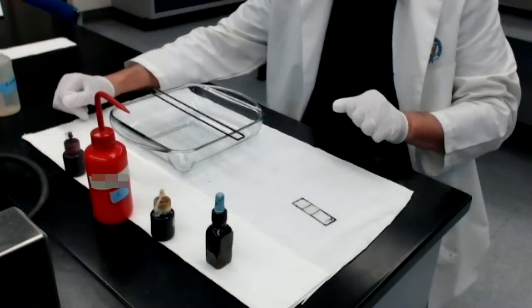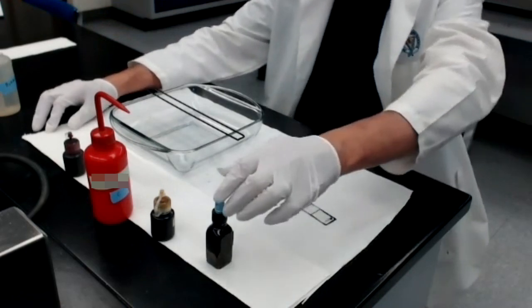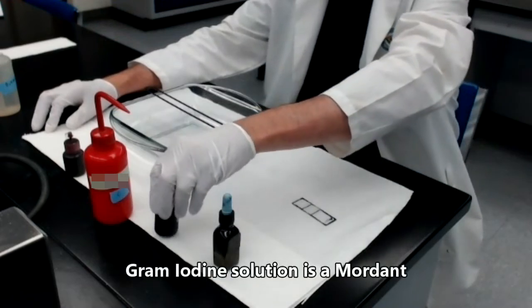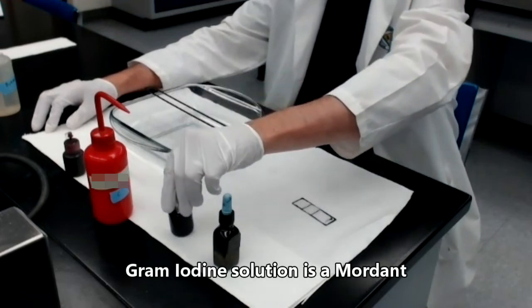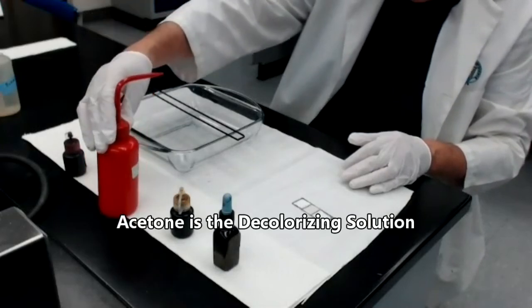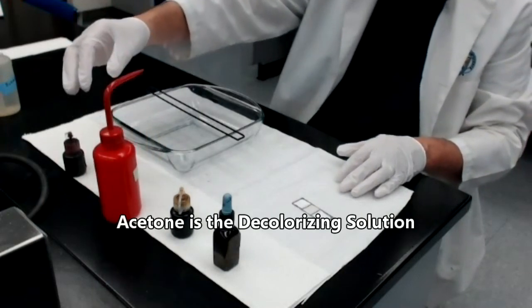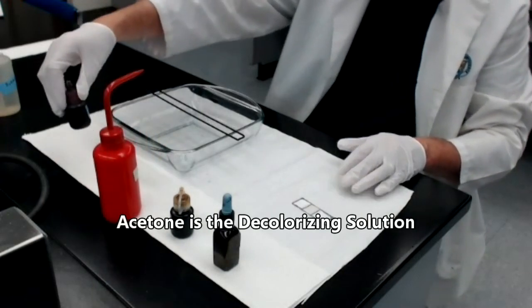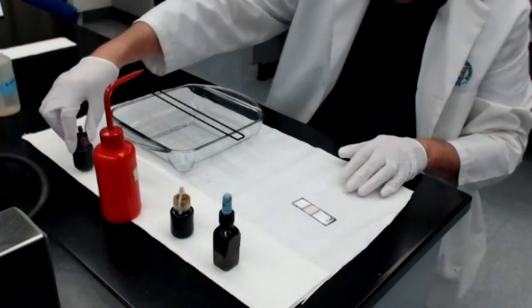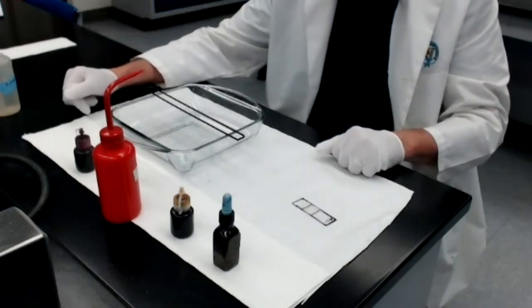Now, it turns out there are other reagents we have to use in order to do the Gram stain. What we'll do first is we will cover the smear with crystal violet for about 60 seconds, then we'll wash that off. We'll cover the smear with Gram iodine for 60 seconds and wash it off. Then we will use this acetone solution for the decolorizing step, and then finally, we will, of course, wash that off. And then we will finish up by using the counter stain, safranin, for 60 seconds, and then washing it off and blotting the slide dry.